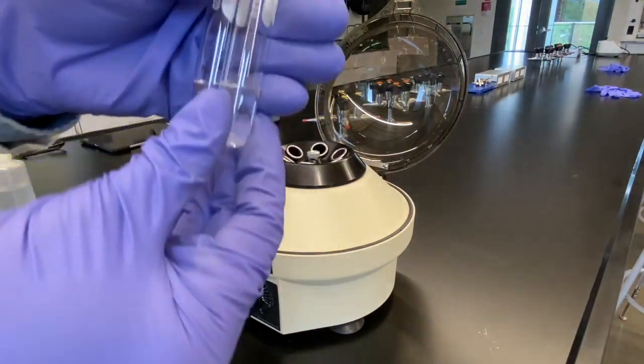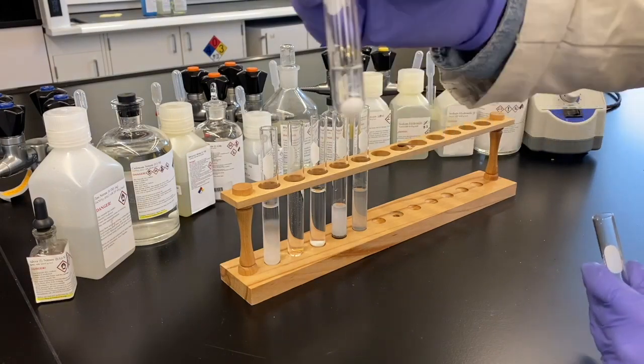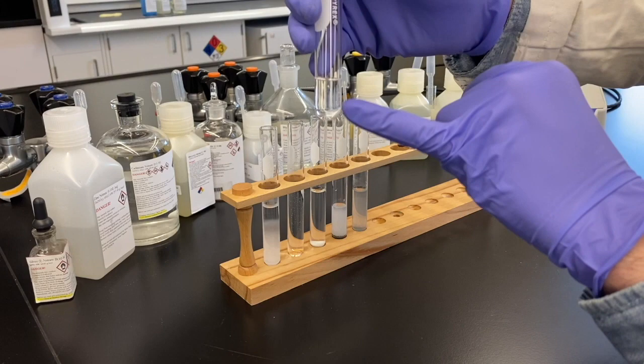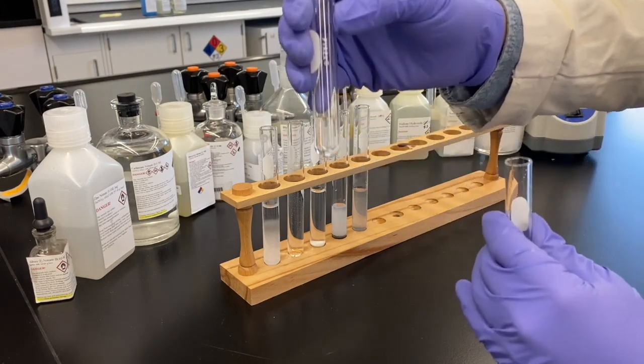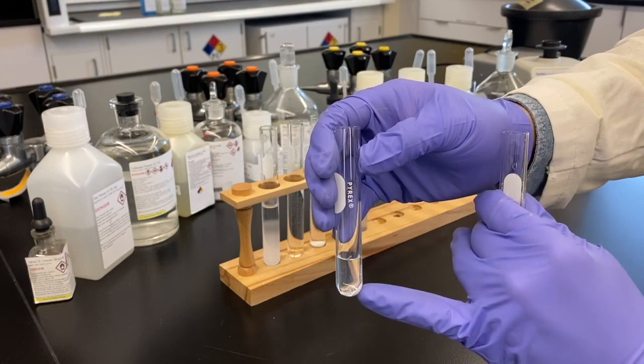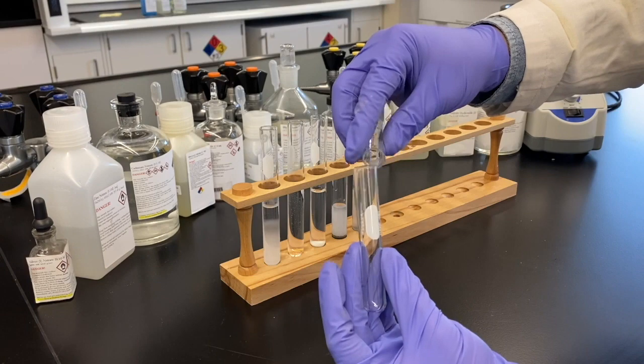Right. So at the bottom of the spun down test tube here, we have the solid, and then the liquid on top of that is called the supernate. That could contain zinc, cadmium, or mercury 2. We don't know, so we have to separate it off. Cool. Yeah, so that supernate then would be the right side of our reaction tree. Right. Any of those possible.